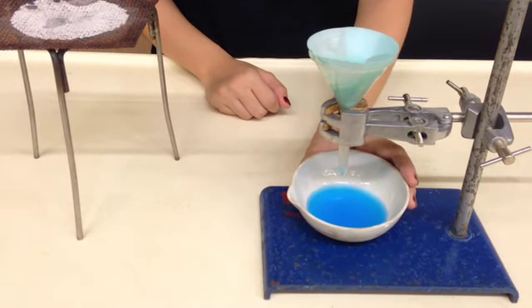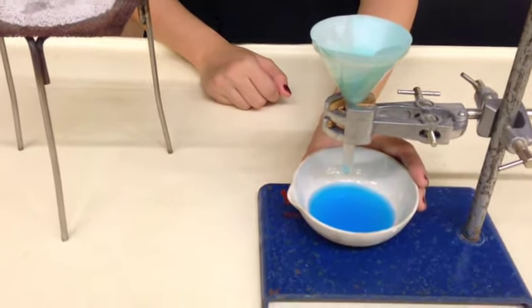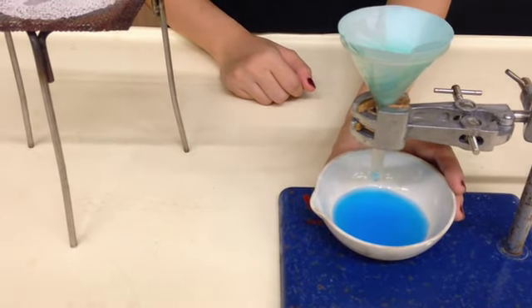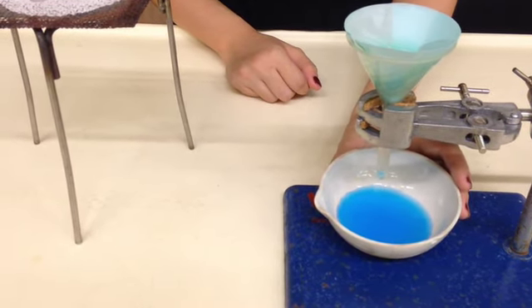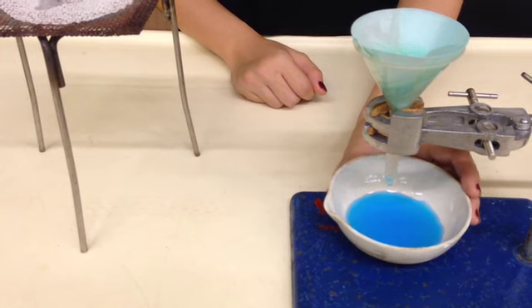You can see here in this evaporating dish the characteristic blue color solution of copper 2 sulfate. Some of you might be wondering if you're already done when you reach this step.